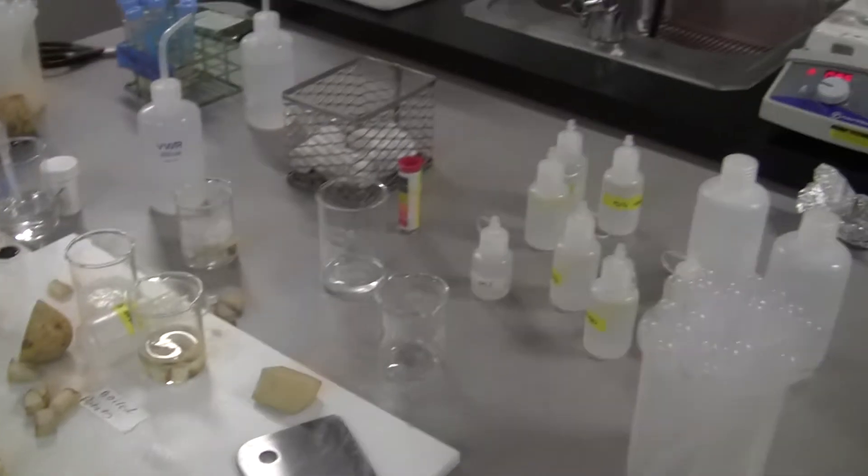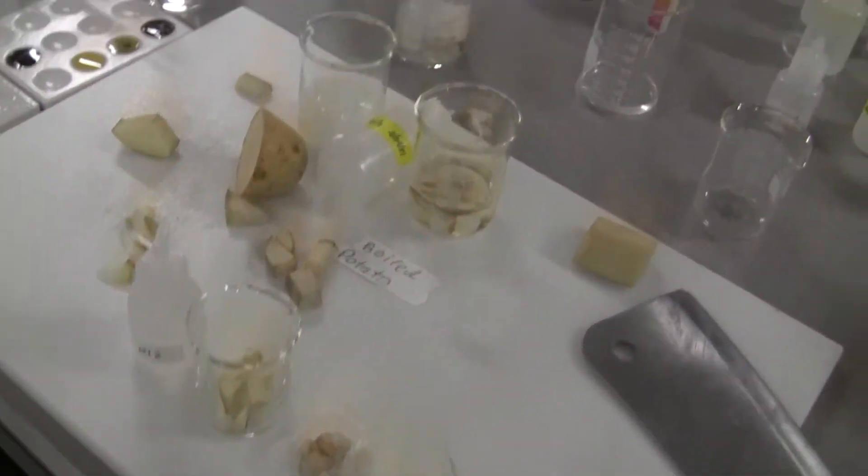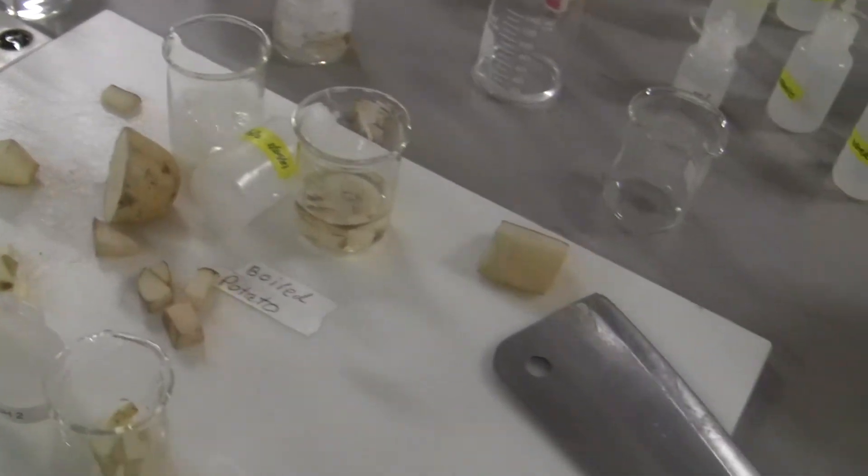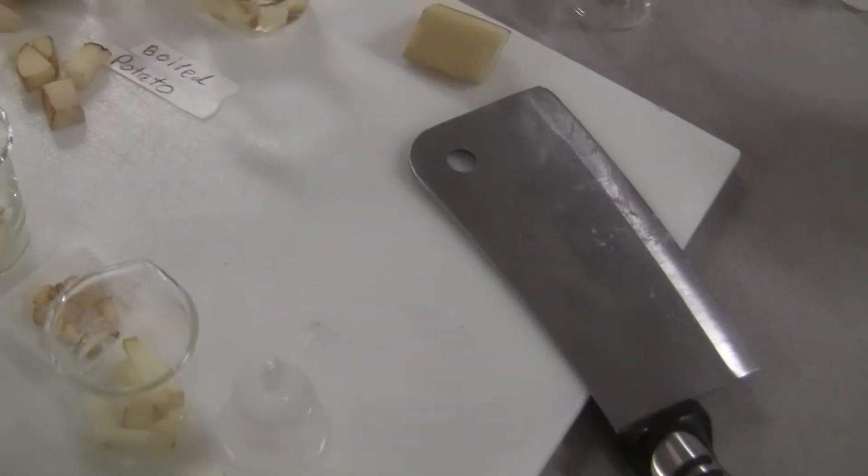Hello guys, this is the enzymes lab which we are going to do with potato. As you can see, I cut up some potato here and then I pour some potato.